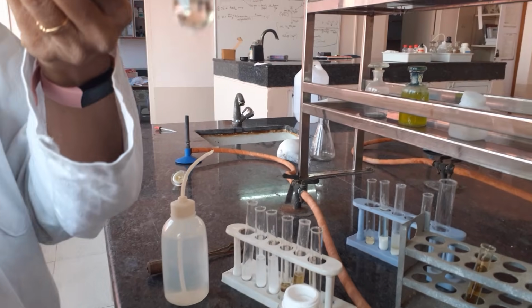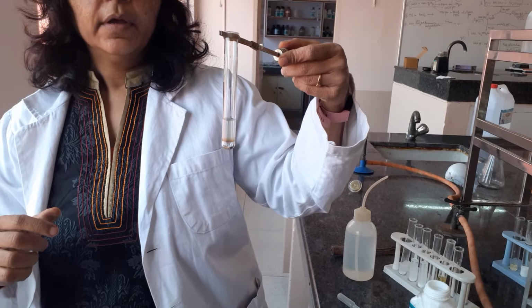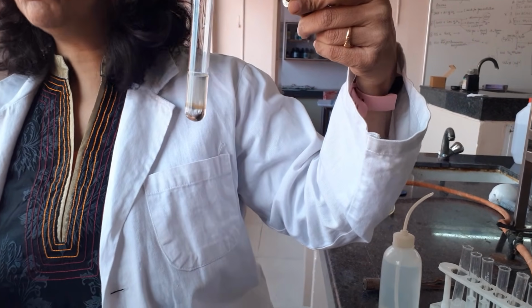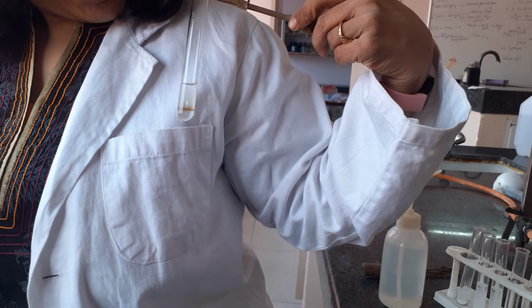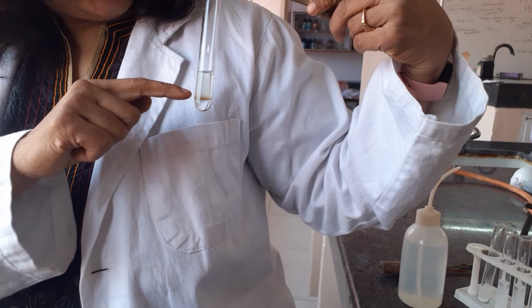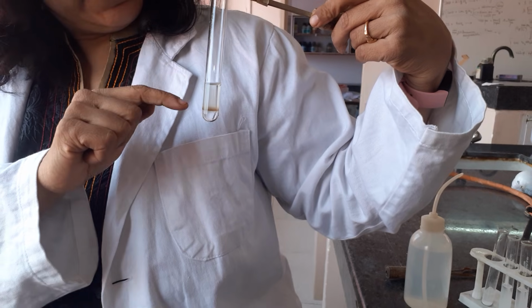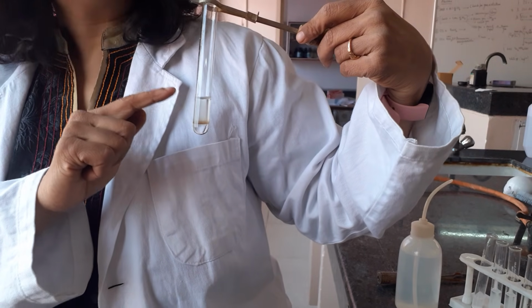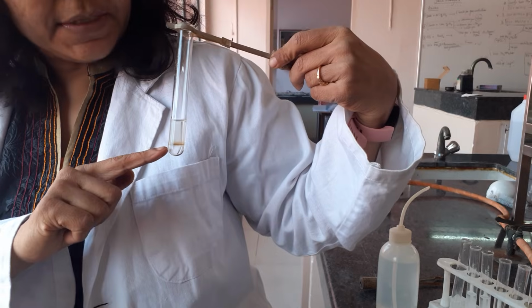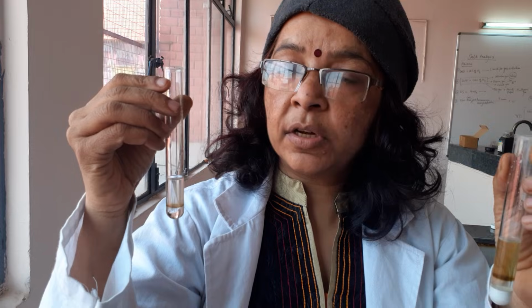Now carefully straighten it up and wait for the brown ring to appear. It might take a small amount of time. Wait for a minute for the brown ring to appear and then try to observe it on a white background. Can you see a thin brown line at this joint of concentrated sulfuric acid and your solution? This is called the junction, where you get a thin brown ring. That is how the test is to be performed if you get a white ppt on adding the ferrous sulfate. Have a close look, this is the practical that I just did, and I am showing you the brown ring at the junction.